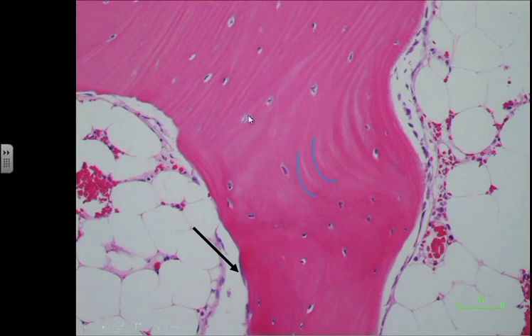We can see even the osteocytes, these cells that are embedded, have a certain arrangement in parallel with the lamellae. I put two blue curves over here to show you that some of the lamellae start to be concentric and circular, but again they are parallel. So here, parallel, parallel, parallel, right? The black arrow again highlights the bone surface cell, or lining cell.